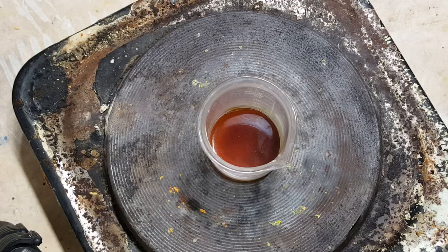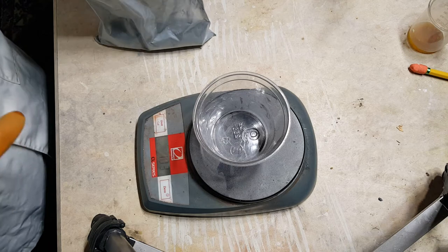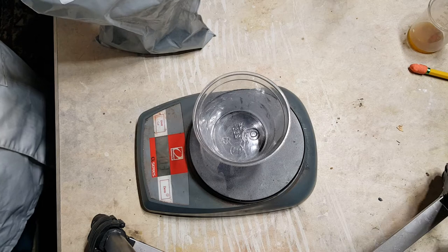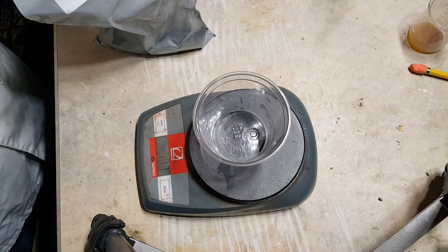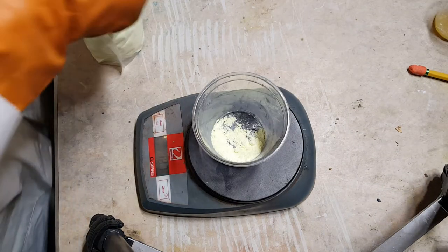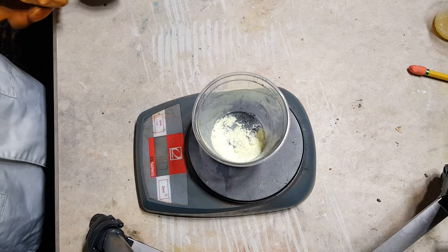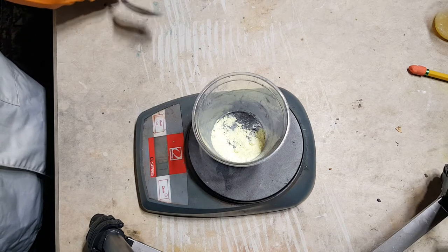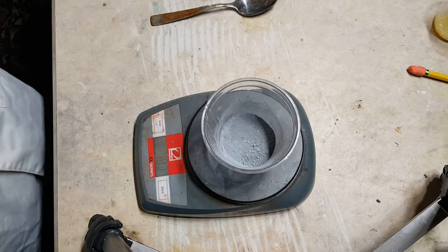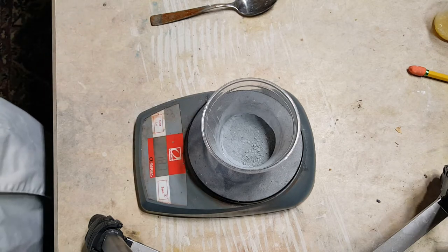Let's do a few reactions with sulfur. Next I'm going to mix some zinc powder and sulfur powder and watch the reaction. Then I'm going to be burning sulfur in standard atmospheric oxygen concentration, which is only about 20% oxygen. I have the zinc and the sulfur mixed at the stoichiometric ratio of one gram of zinc to 0.49 grams of sulfur. Now that I've got the sulfur and zinc mixed thoroughly, let's go out back and watch the reactions.